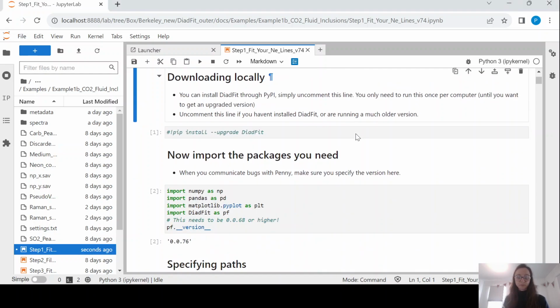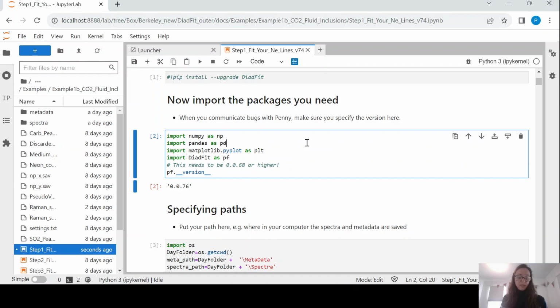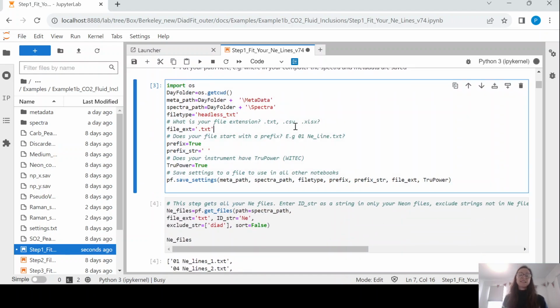Okay. So you're going to import all of your Python things, and then this is where you're going to tell Python various things that you've done. So I have asked you to tell me what folder your metadata is in. Here we are saying that we have put this notebook in the overall folder. That's the day folder, so that's the entire day of Raman analyses. And then there's a subfolder with my metadata and a subfolder with my spectra.